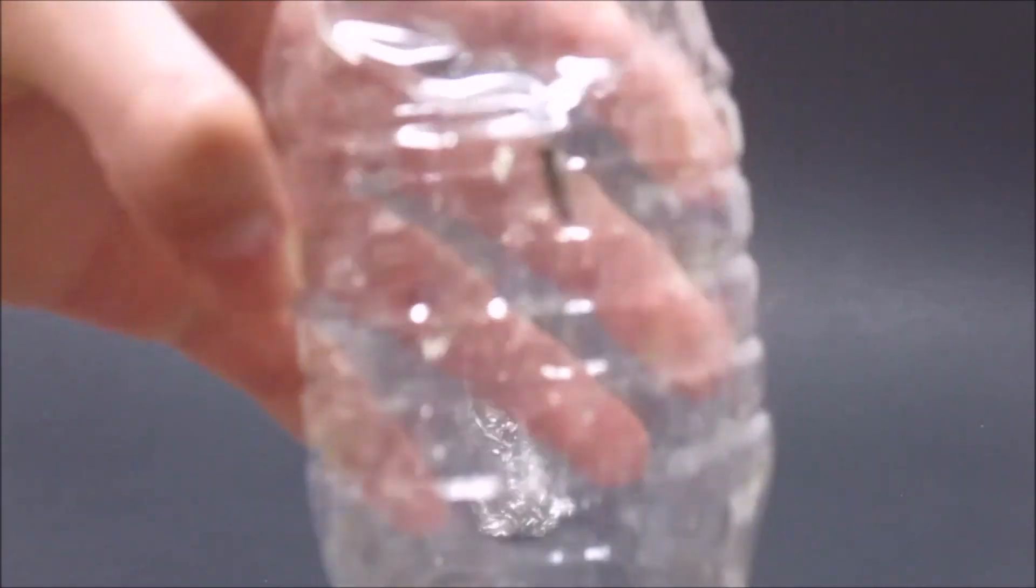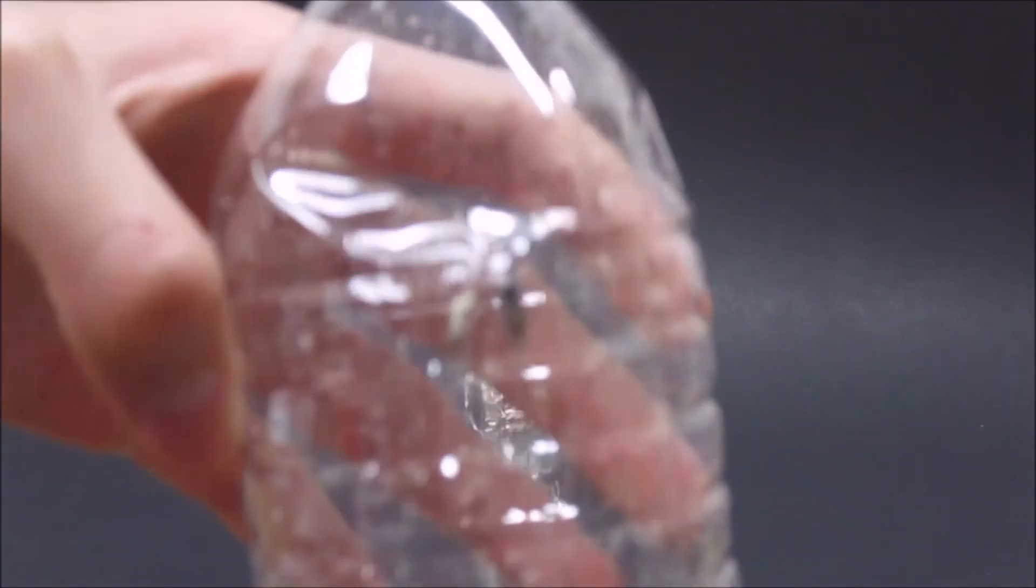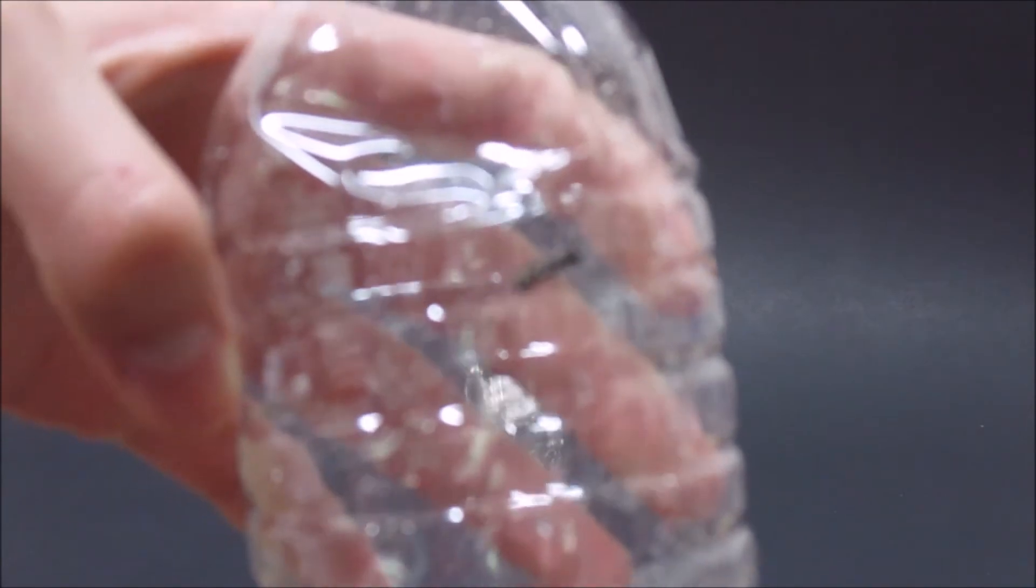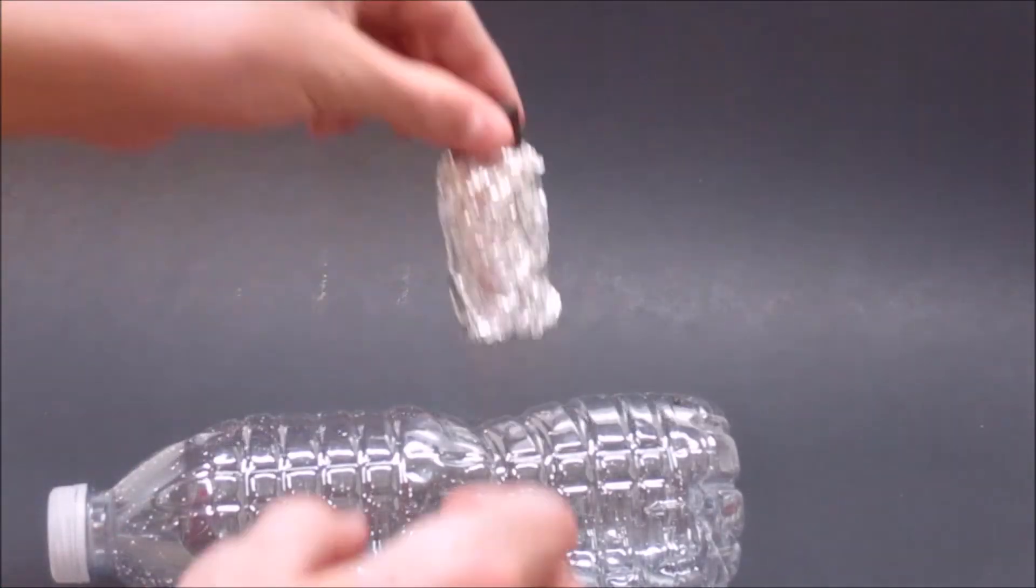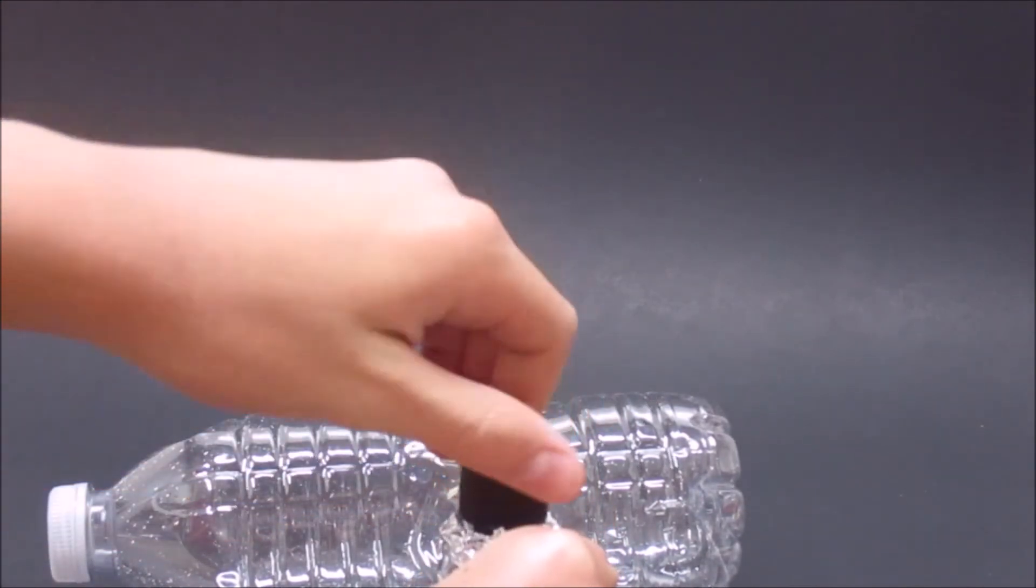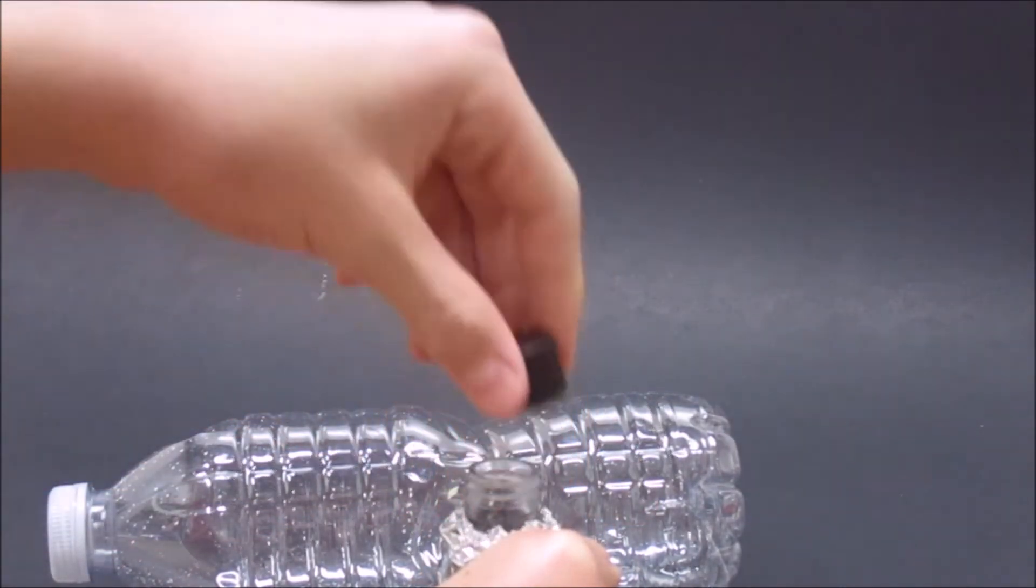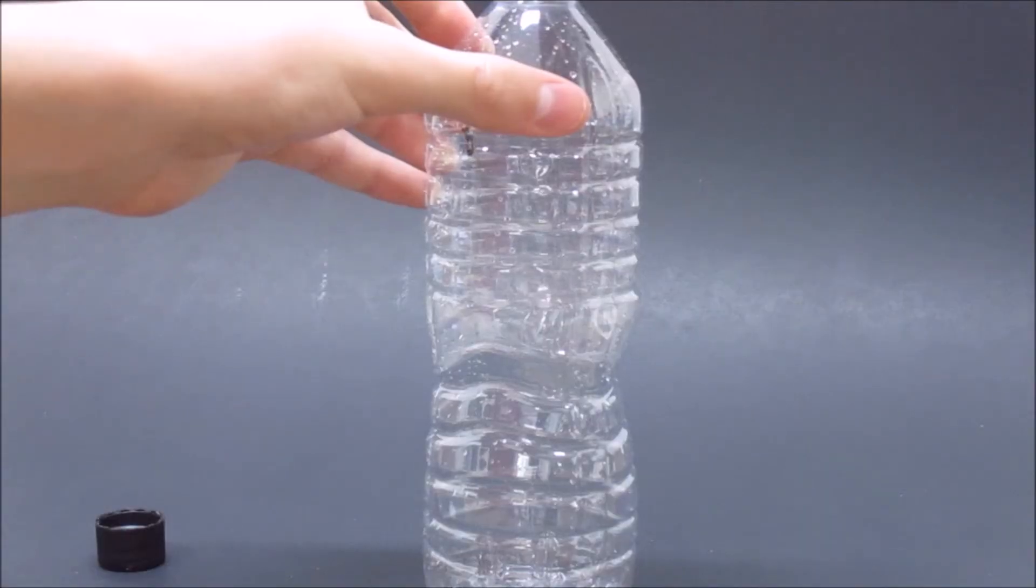To see if I really have made chloroform, I went outside and caught a bug. I unscrewed the cap of my chloroform bottle and then I poured a little bit of chloroform into the bottle with the bug.